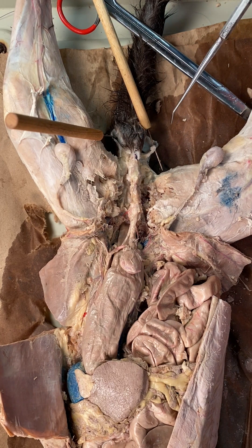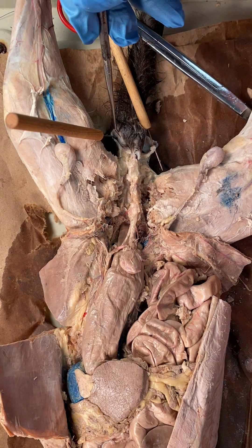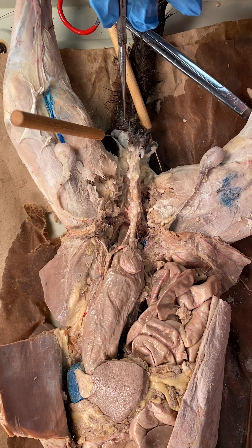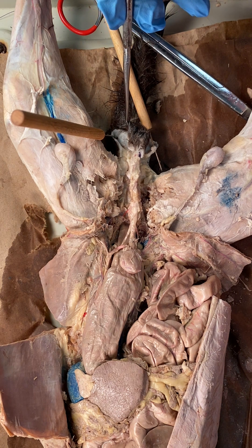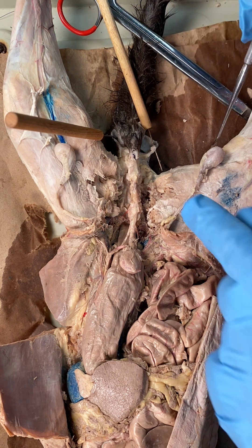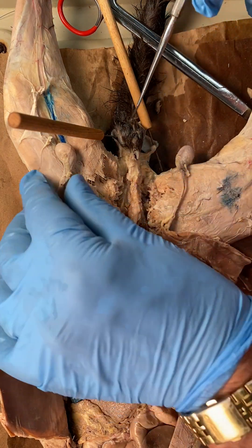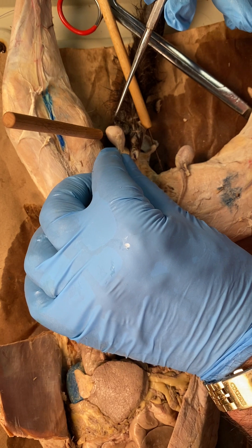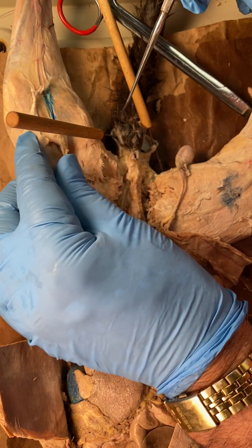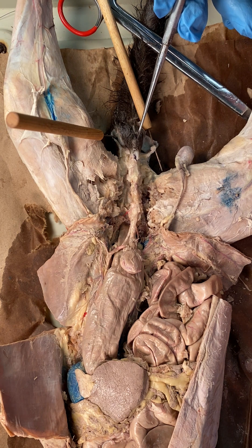This is the reproductive system of the male cat. Starting down towards the bottom: that little sack is the left scrotum, and over here is the right scrotum. Inside those were the testes. There's the right testes up on the thigh — we took them out so you could see them better — and there's the left testes right here. That's the head of the penis, the glans penis.